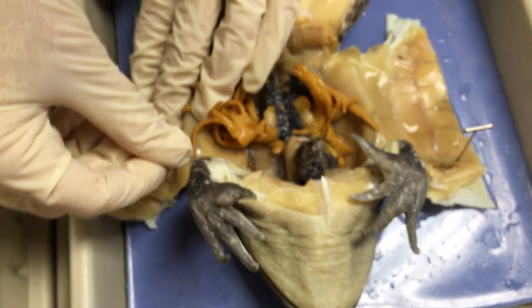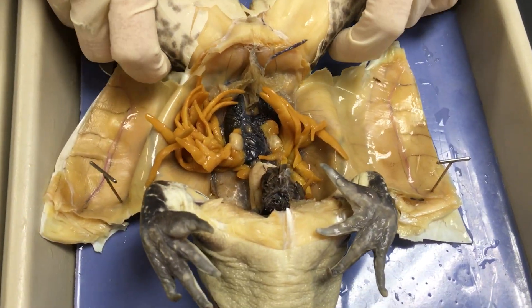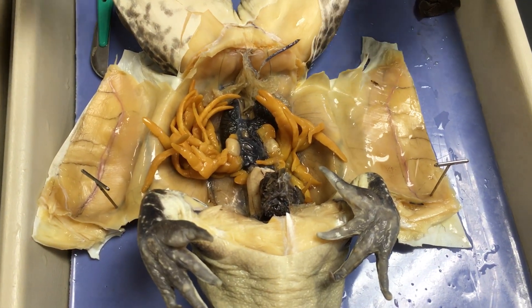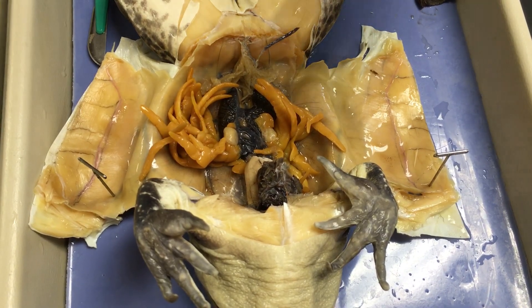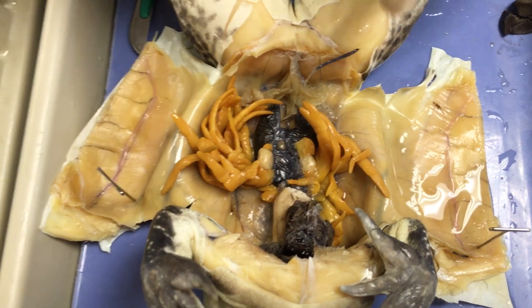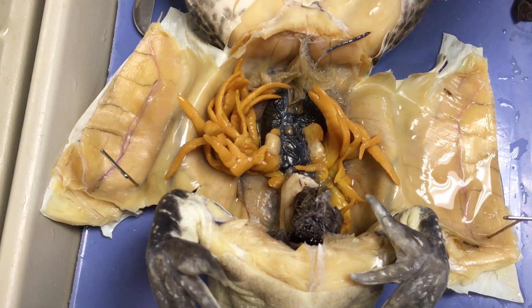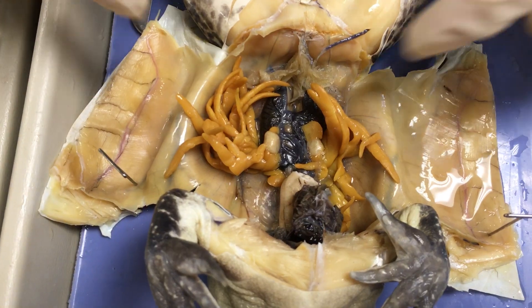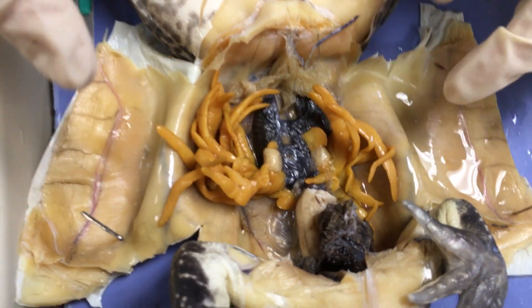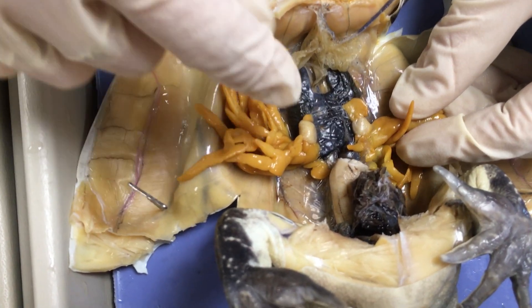Mr. Oliver mentioned amplexus when we talked about the external anatomy of the frog — those are the different positions that frogs get in for copulation. The female will release the eggs and the male will release the sperm, so there is no internal fertilization in frogs. The majority of the differences are in the internal sex organs. Outside, they don't need to look very different because there's nothing about the external anatomy that's contributing to fertilization. So once you've looked at the outside and made a guess, you can use their sex organs internally to confirm.